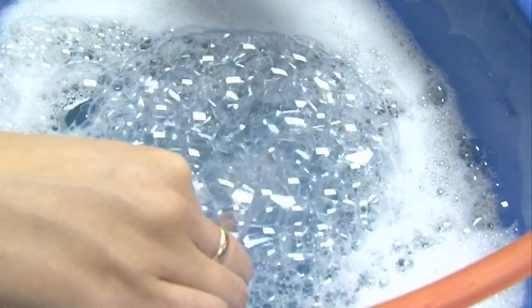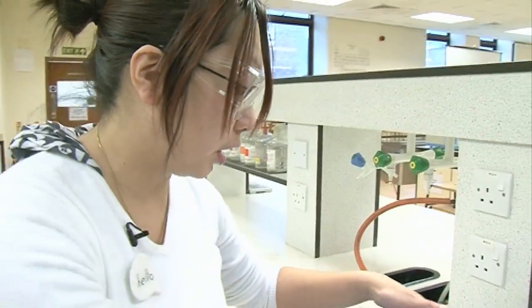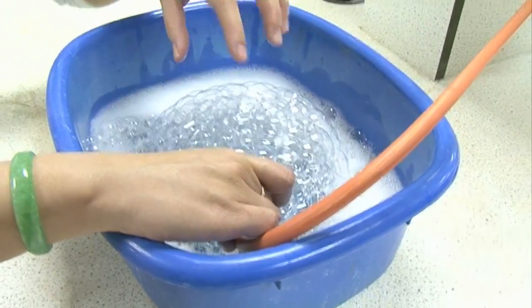So all that's happening, and obviously I've got the benefit of being able to smell it as well as hear it, is that the methane gas bubbles are forming, they're soap bubbles, but instead of it being air trapped inside each bubble, every single bubble there has methane inside it.